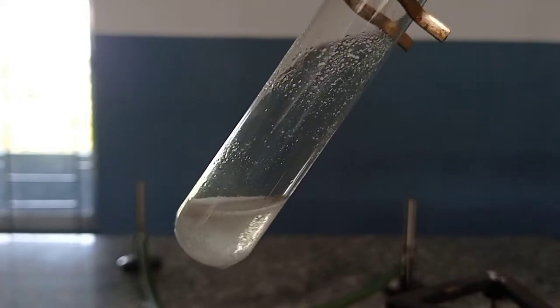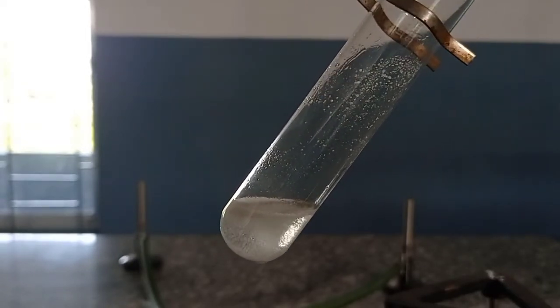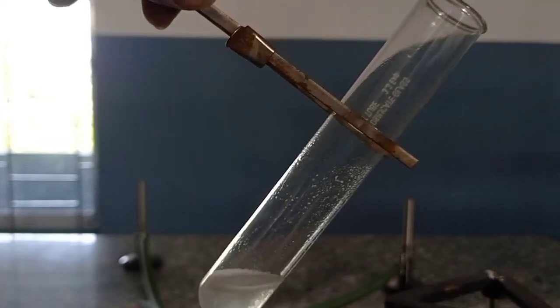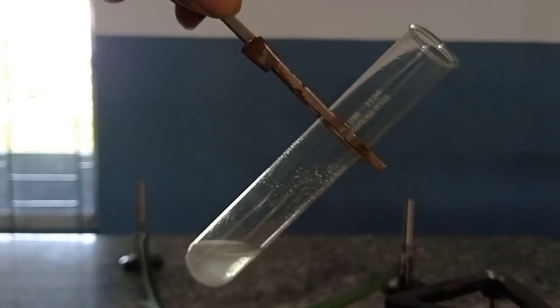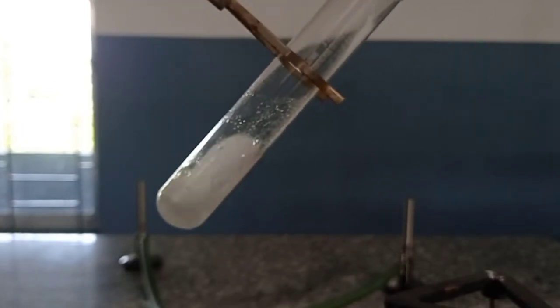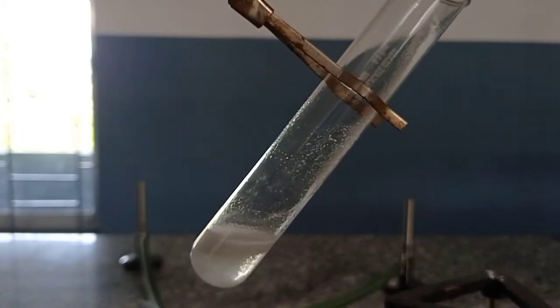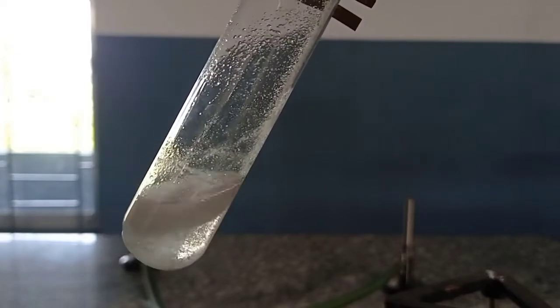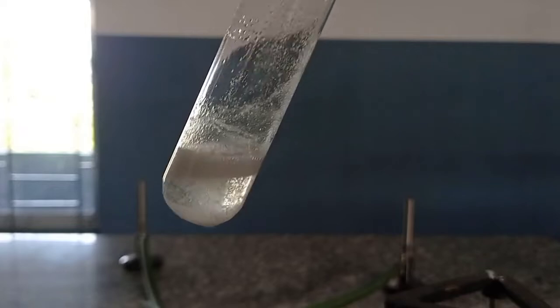You can see clearly, my dear students, how the effervescence has formed — the bubbling is still continuing. Let me add a little more amount of salt to see what happens. You can see that since the acid has already been used for the formation of effervescence, this time I am not getting such a huge response, but still the gas is coming out in the form of effervescence.